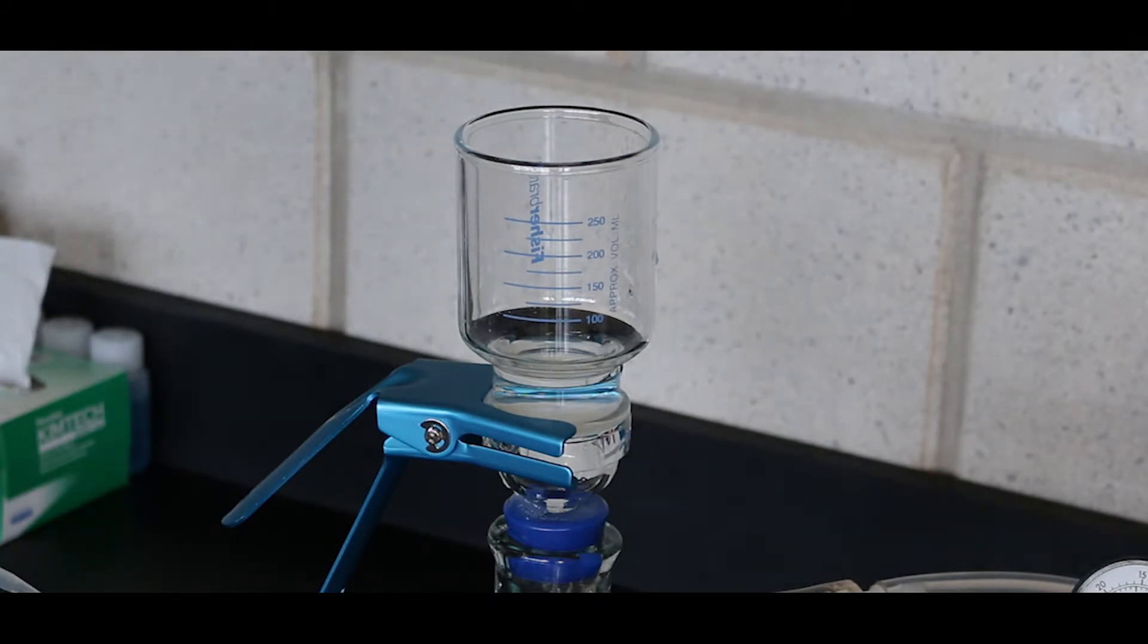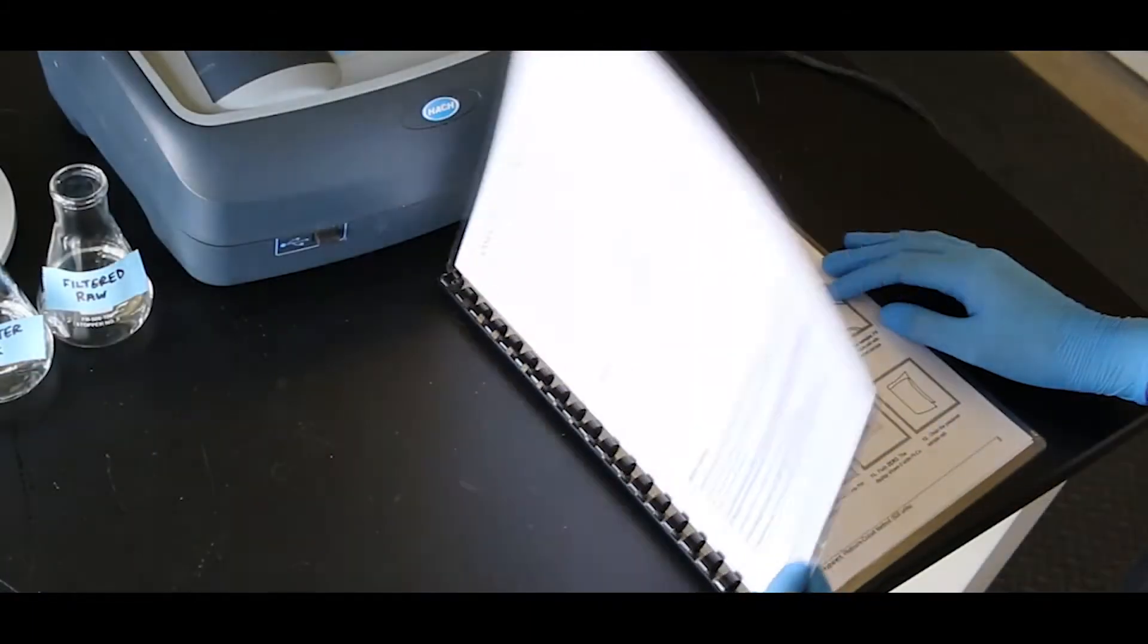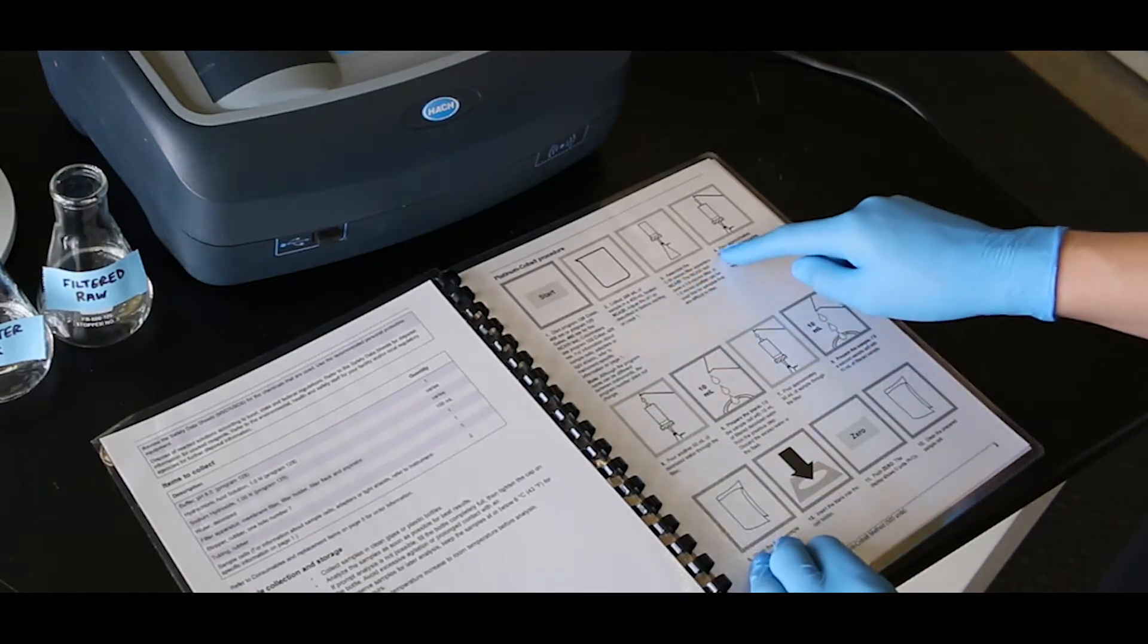This video will demonstrate how to properly analyze the apparent color of a water sample by the platinum cobalt standard method.